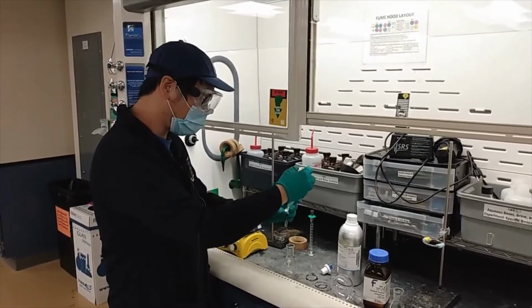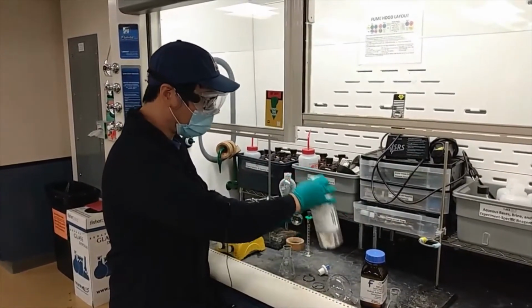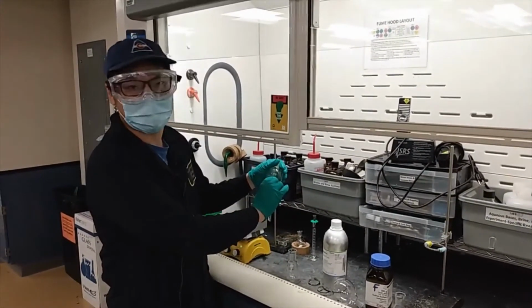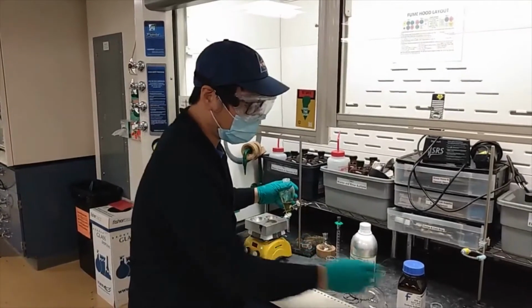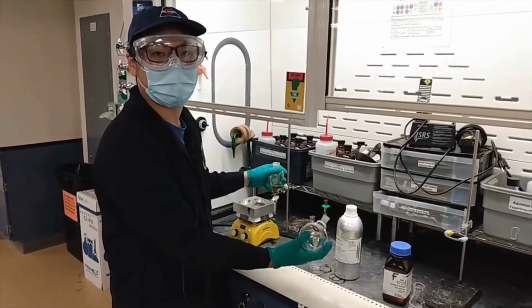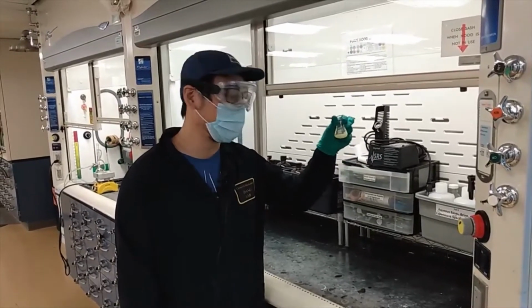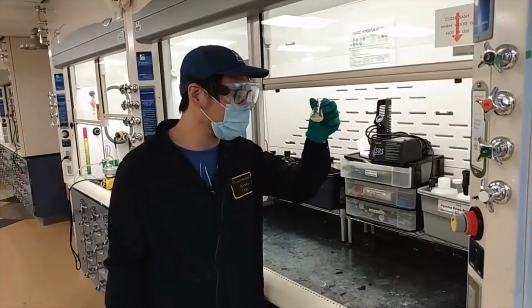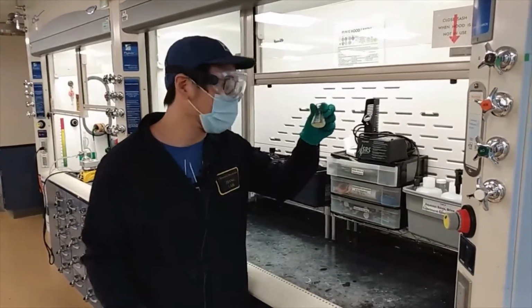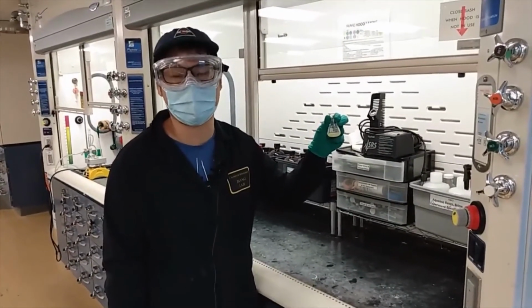So we will pour it into the separatory funnel and wash that with the ether, and we will combine all the organic phases together. Then through the drying agents and rotovap, we will have our final product, and we will perform the recrystallization from water. After recrystallizing from the hot water, we observed some white crystal precipitate out from the cold water, and we will use those. We will do the vacuum filtration to collect the solid and use it for the second step, the hydrogenation.